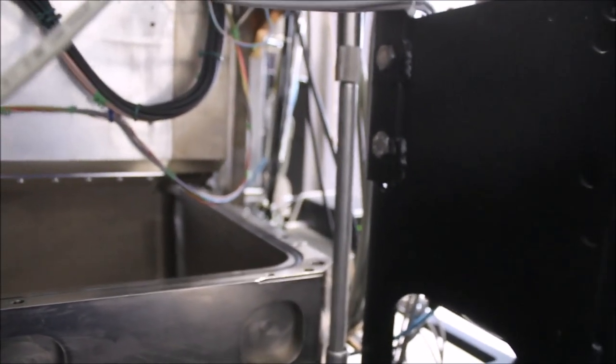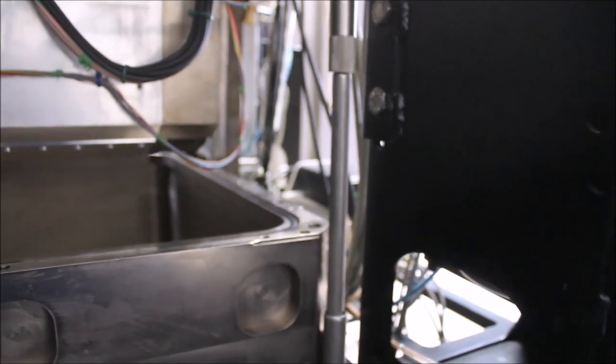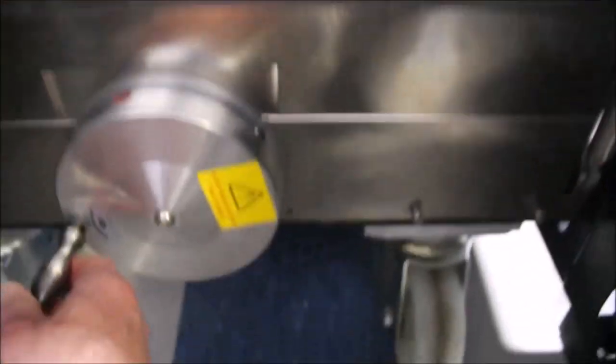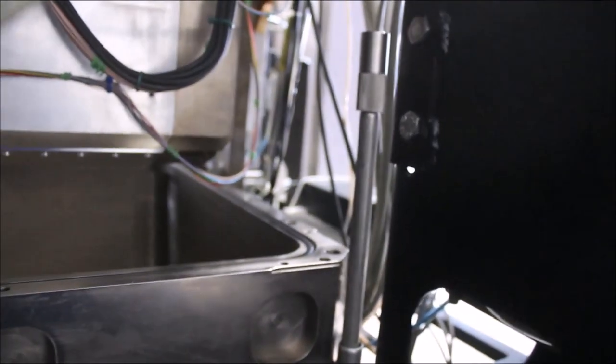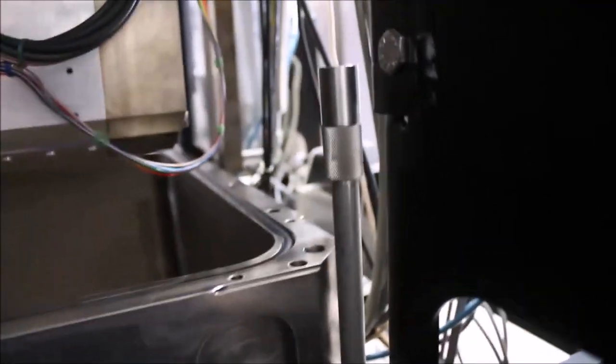Let's see if I can get a good image of that. You can see there's the little antenna. As I turn the crank, you can see that it gets pulled down. It's very important that we always keep tension on these cables or else the little winch inside the sump will get all tangled up and we'll have a really big problem. We've got to make sure all these cables are retracted so they don't get damaged.